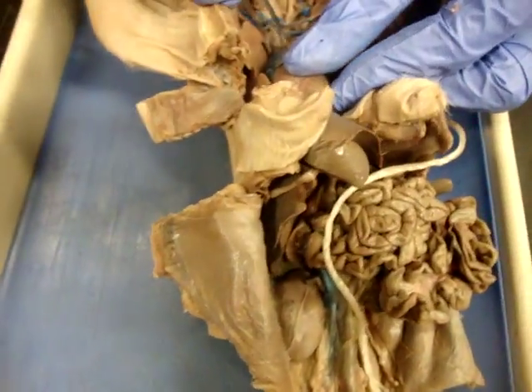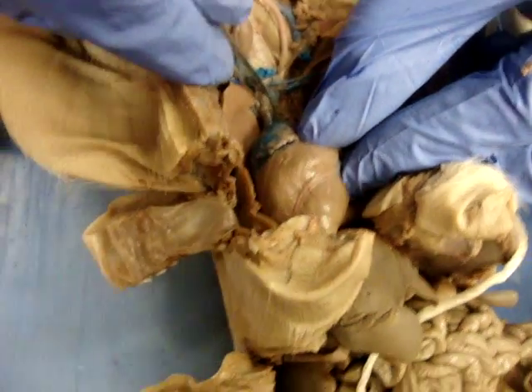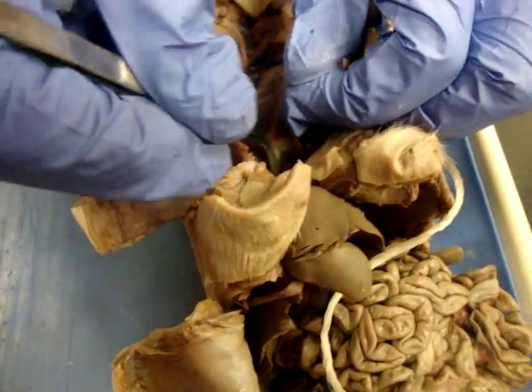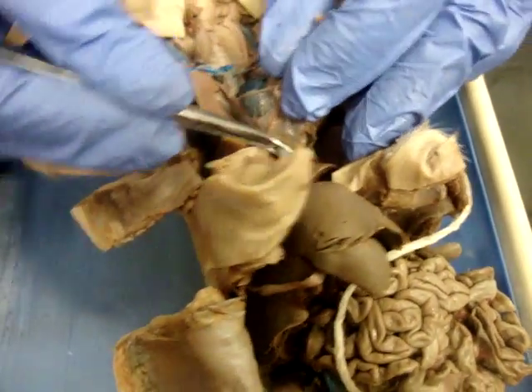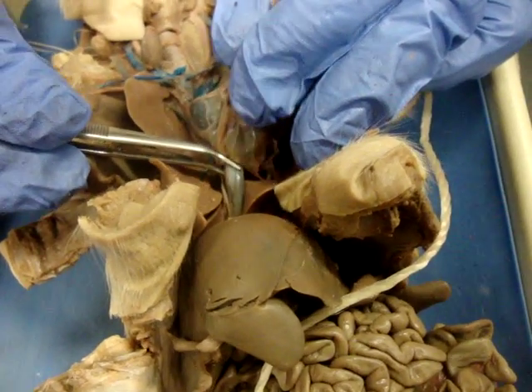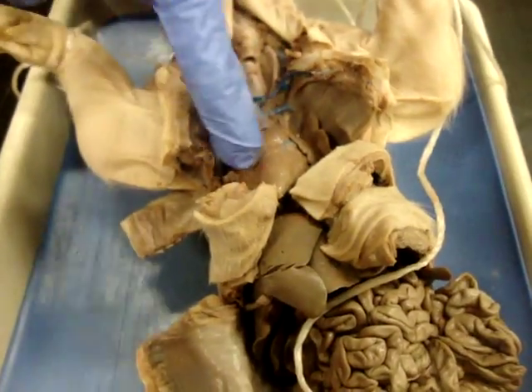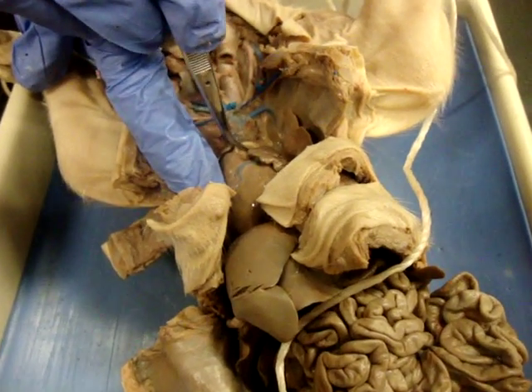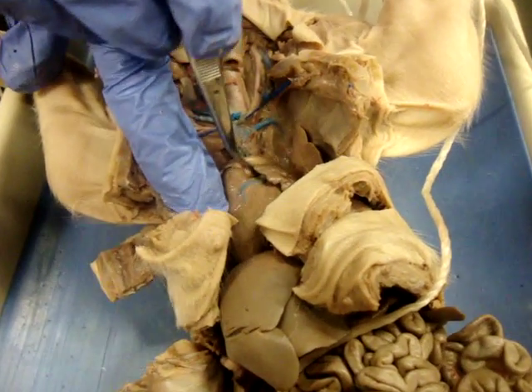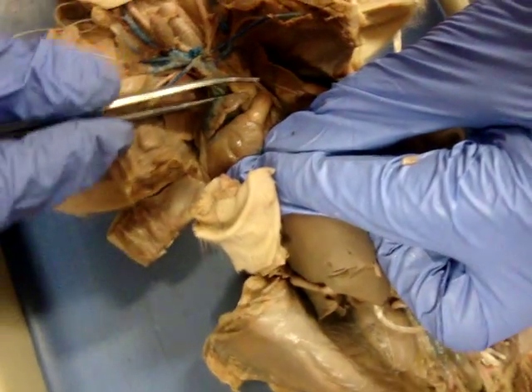From there we get into the heart. You're going to find your anterior vena cava — in humans, this would be the superior. You find your posterior vena cava, also known as your inferior if this was a human. On the heart itself, you can find the pulmonary trunk. This is the one that comes across the front — everyone always mixes this one up. Make sure you know that this is your pulmonary trunk and the aorta is actually back behind it.